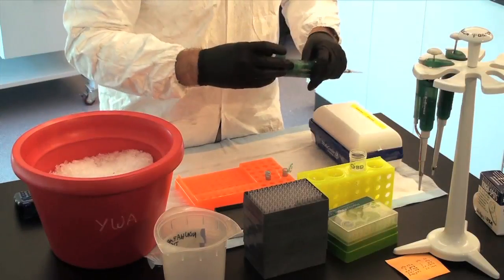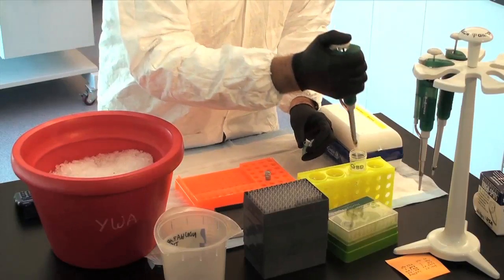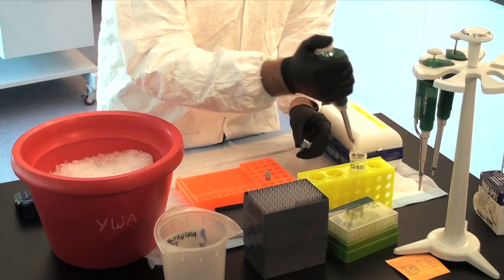Step 1: Add sufficient water that the total volume when buffer, enzymes, and DNA are added together in order, total 50 microliters.